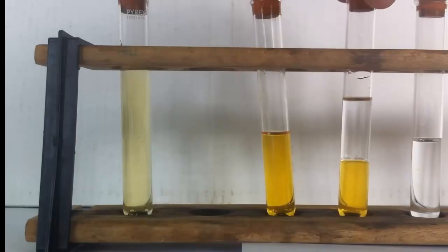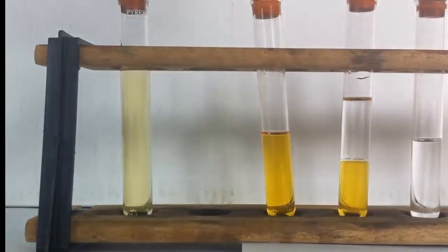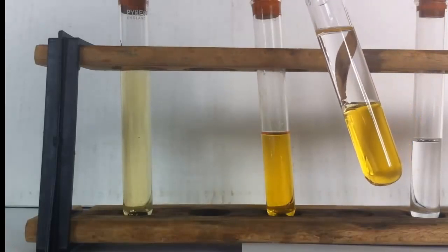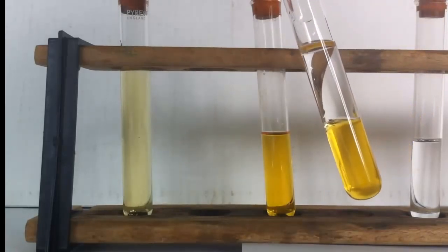Now at this stage because the liquids are immiscible the reaction would take some time, probably 30 minutes or more. But if I shake the two chemicals through one another the reaction will occur very quickly.